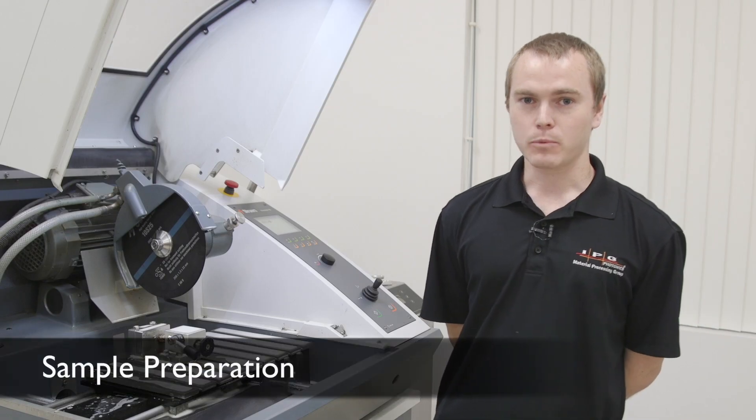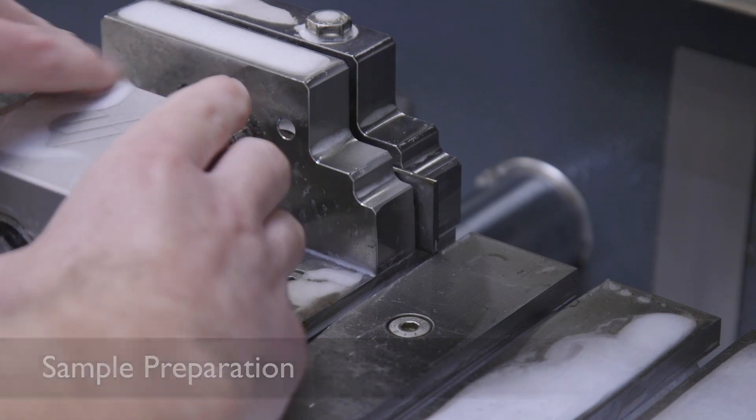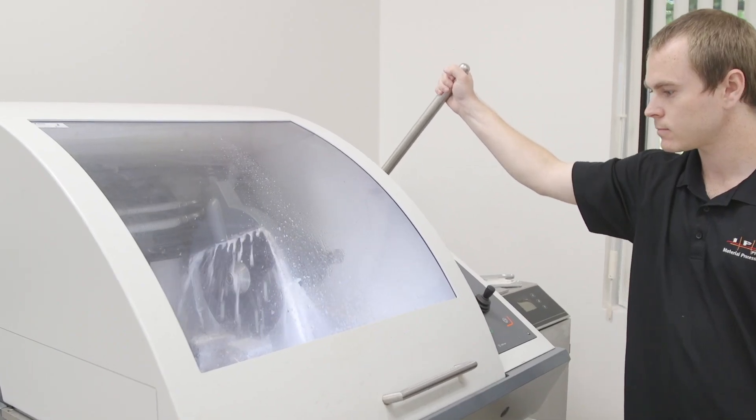Here we're in the sample preparation area where we are using a cutoff saw to dice up welding samples for mounting, polishing, grinding, and then inspection.